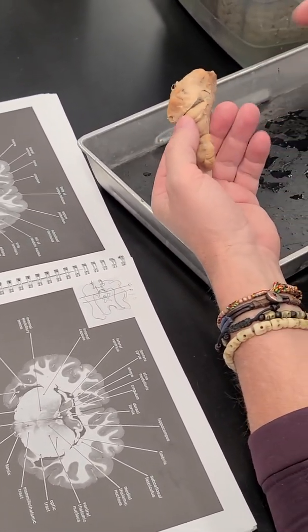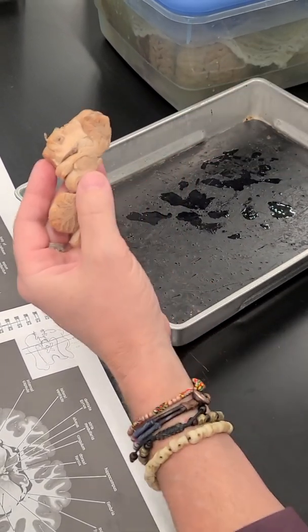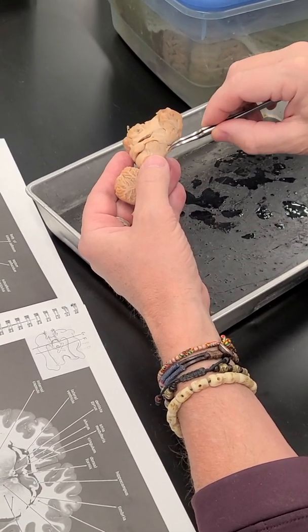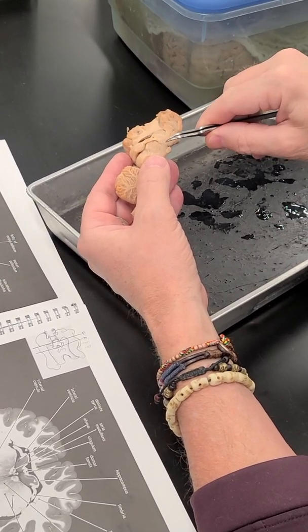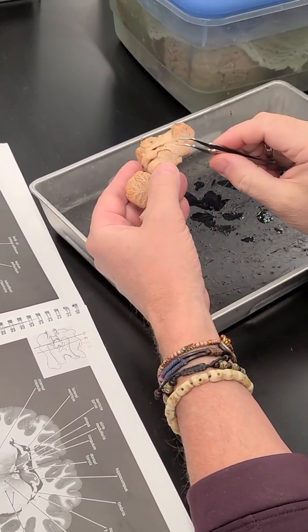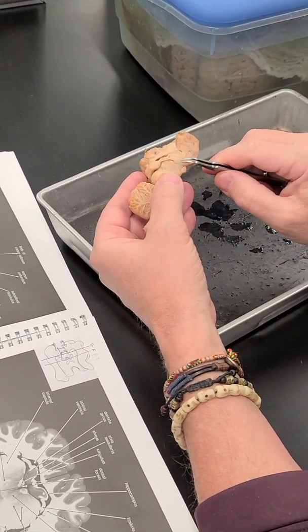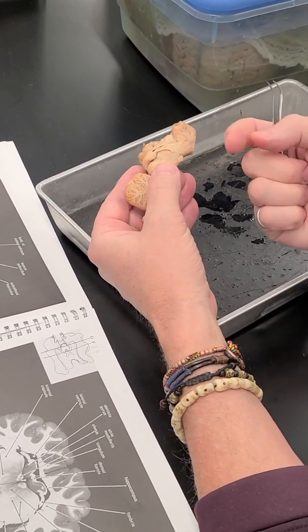And the fimbria comes together to form the fornix. So the fimbria comes together at an angle and then forms the fornix, and then those fibers will proceed down into the hypothalamus and into the septal region. And the ones that go into the hypothalamus are called the postcommissural fibers of the fornix. And the fibers that go into the septal region are called the precommissural fibers, and that's because they're divided by the anterior commissure, which is this little bundle right here that's coming out at us.